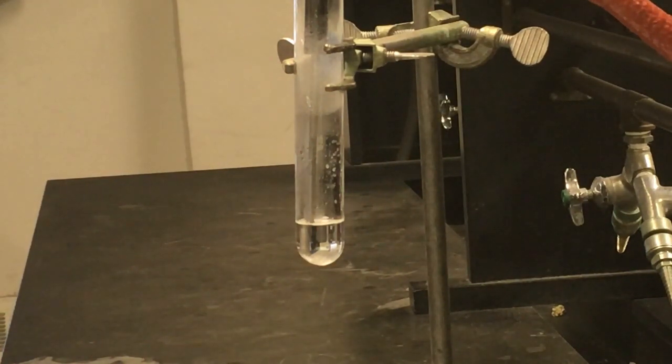We still don't have much yet in the actual solution itself, and we're already down to about 72.5 degrees or so. That's a good bit lower than what we saw at the freezing point the first time, which is, like I said, what we hopefully wanted to see here. I'm going to give this a couple of minutes and let you watch. As I see the crystals form, I'll highlight and point it out, and then I'll let it go all the way through till solid, like before.